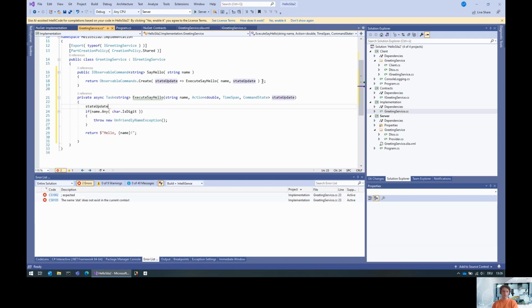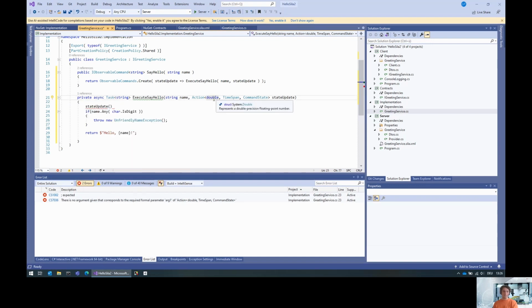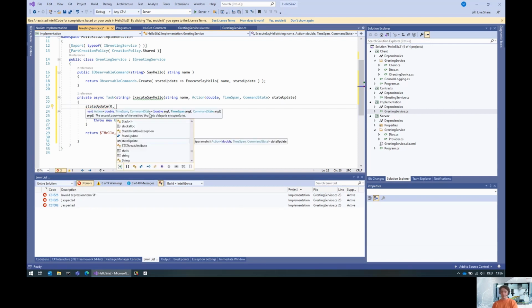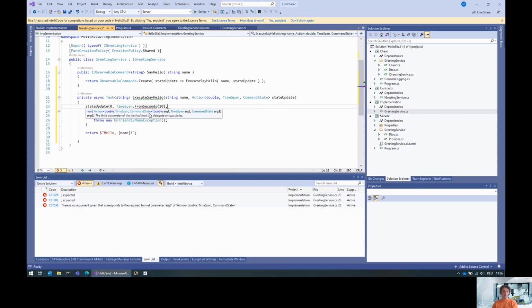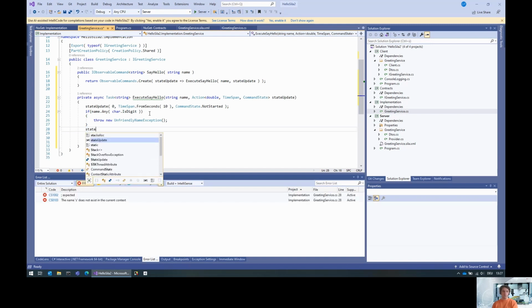So we can say, okay, this double here is the percentage of how far we've been progressing. So we haven't made any progress at all, and we will probably take 10 seconds to complete, and we are in the state that we haven't started yet. Then we check whether the name is correct or not. And afterwards, let's also put a state update that we are actually finished.